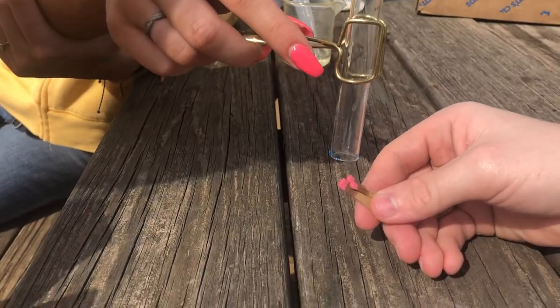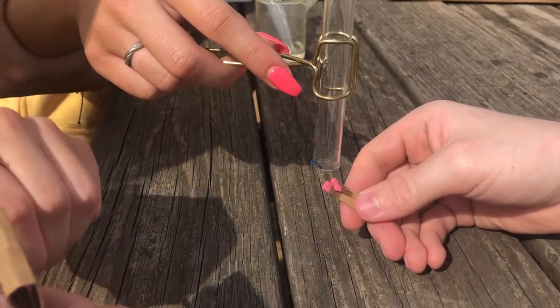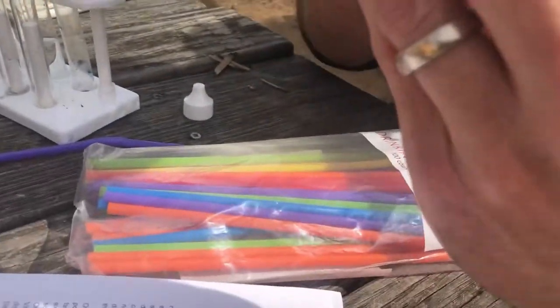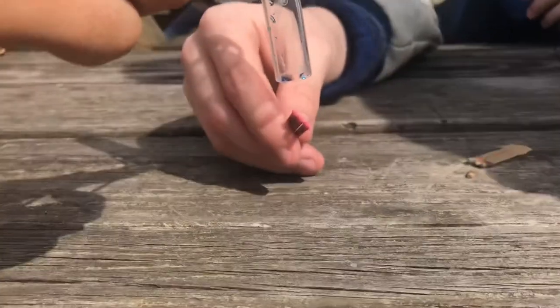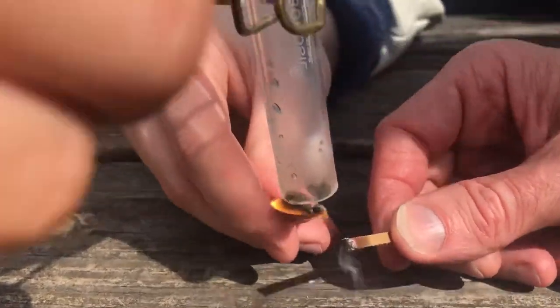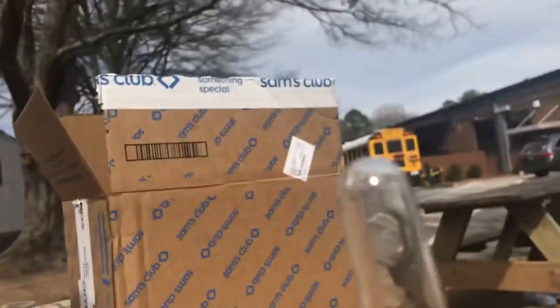After a little practice getting the match to strike, you'll notice down at the open end of the test tube it turned to a very distinct yellow. At the top it's still blue, but down here where the pollution went in, you can see it turned yellow — definitely making it acidic.